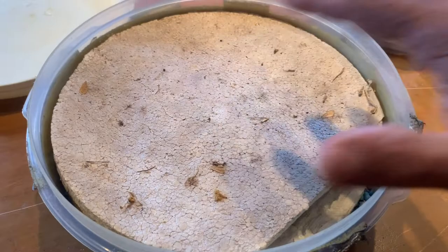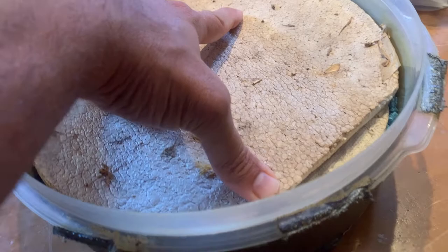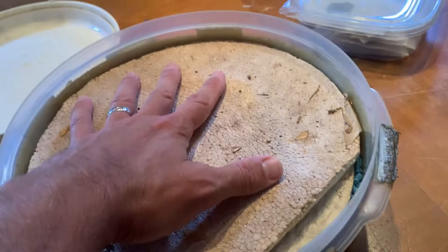I like the styrofoam because it doesn't stay wet. The water is down underneath here — you don't want this surface to be wet and saturated. The water has got to be down underneath here. If this thing is wet and you put your butterfly in here to rehydrate, it's going to take the scales off your butterfly wings. And that's not good.